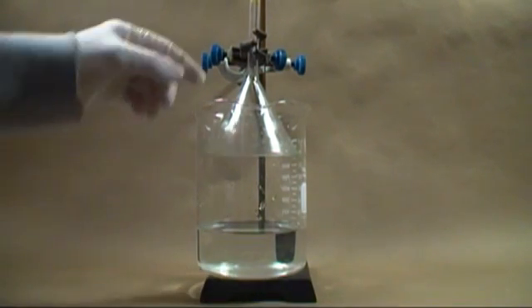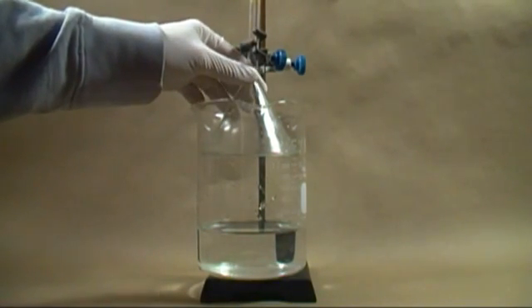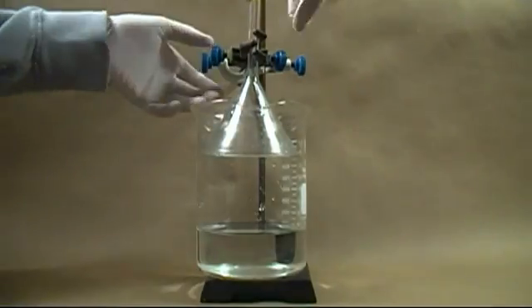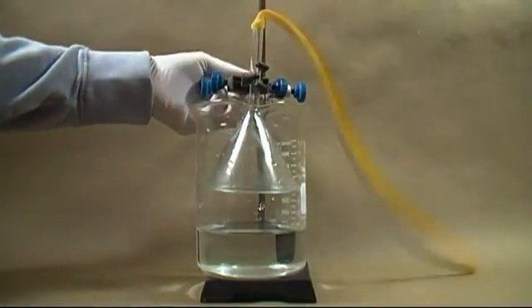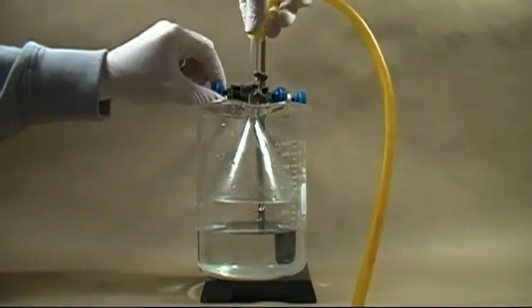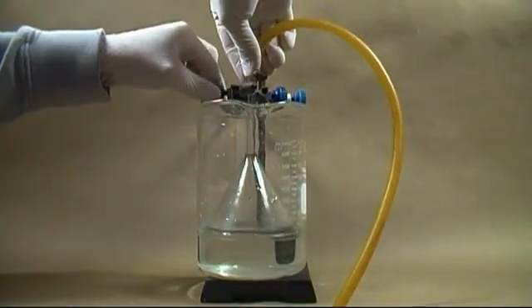The beaker should have however much water you wish to use to dissolve your gas in. Now move the funnel down till the rim is just a couple millimeters below the water level. And now you're set up.